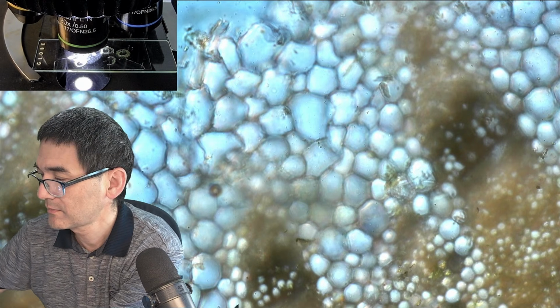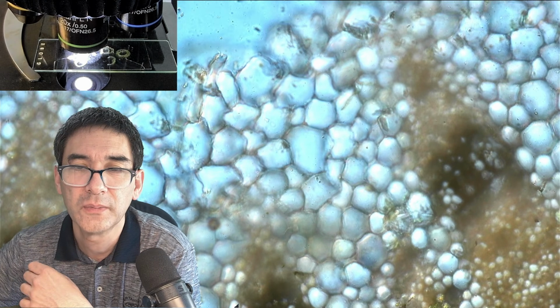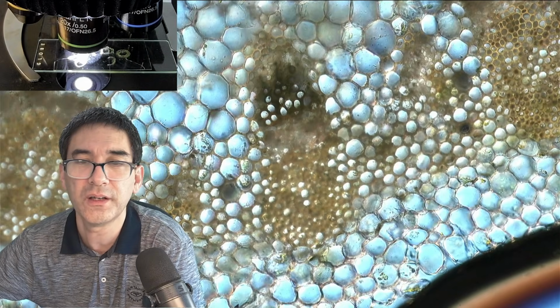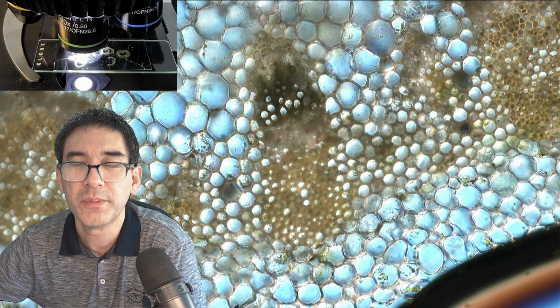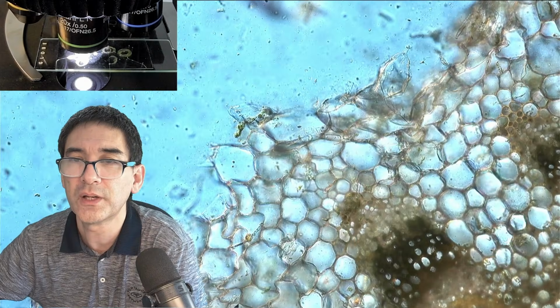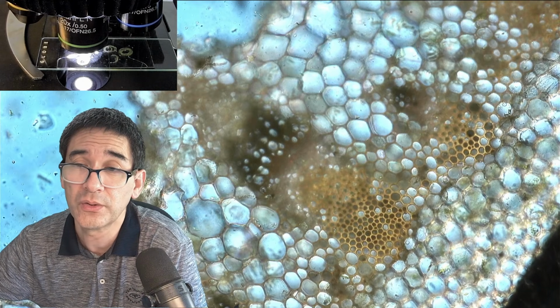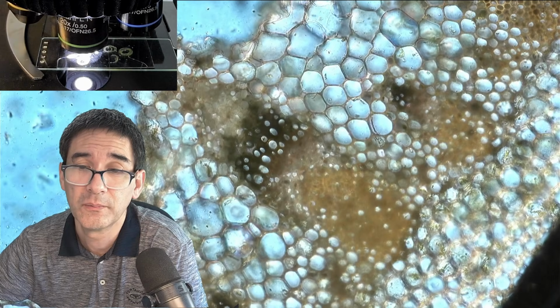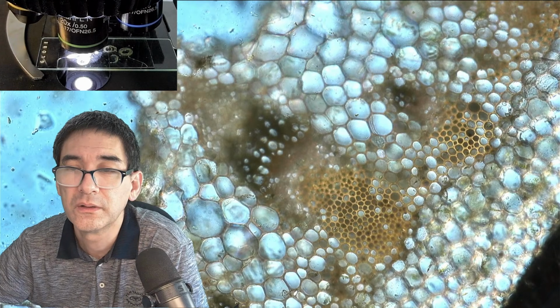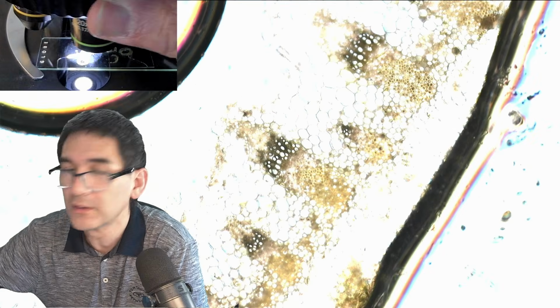Okay, well, actually, zooming in so much really doesn't make it look any better. I think the beauty is those patterns, or the arrangement, that you see, but you can only see them when you have a lower magnification here. Okay, let's go down a little bit.